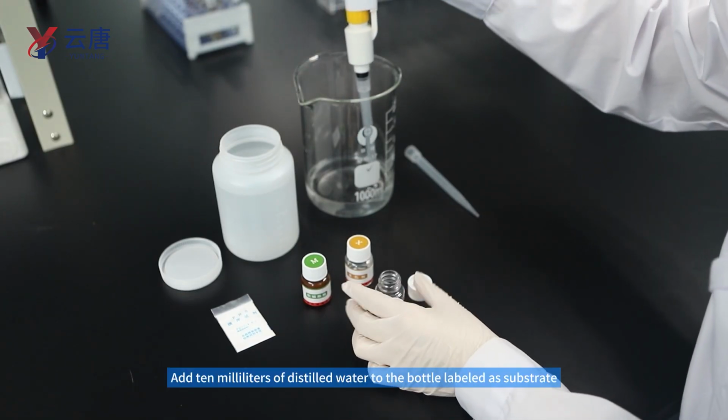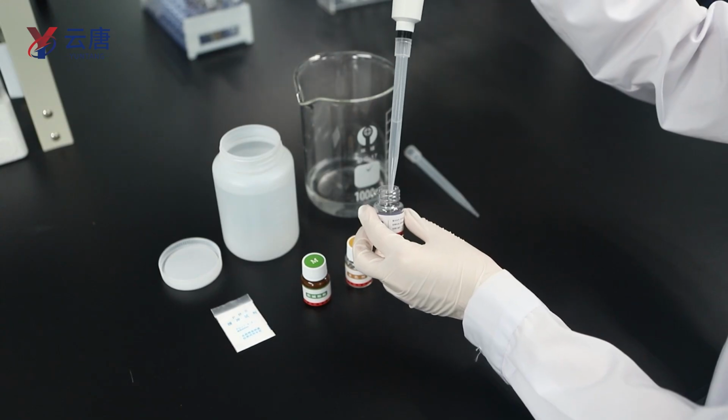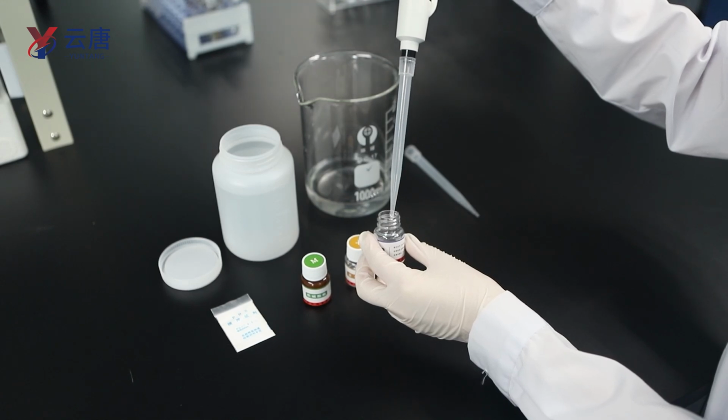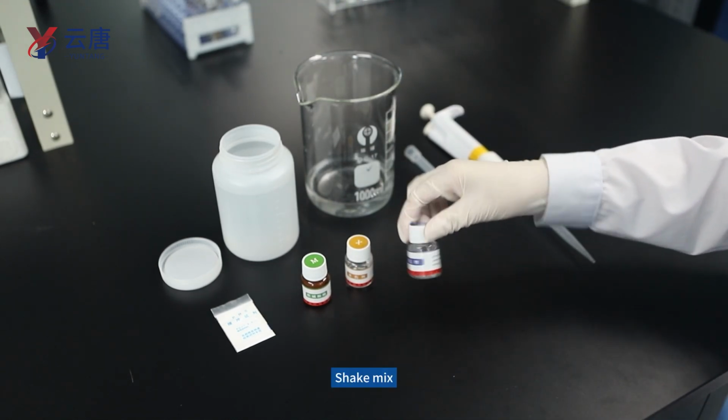Add 10 milliliters of distilled water to the bottle labeled as substrate. Shake mix.